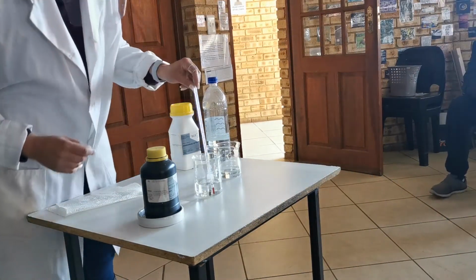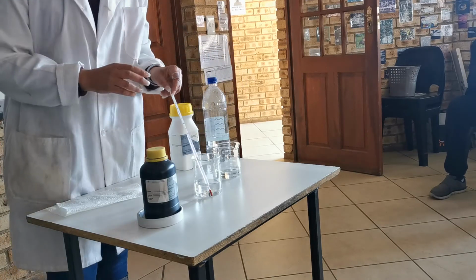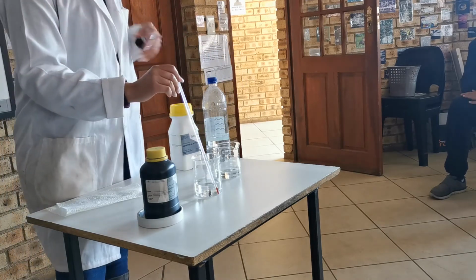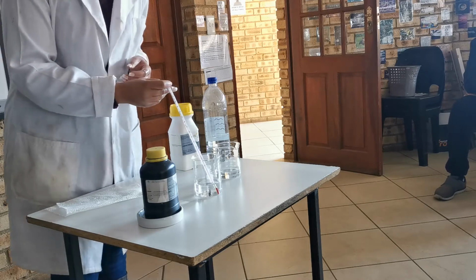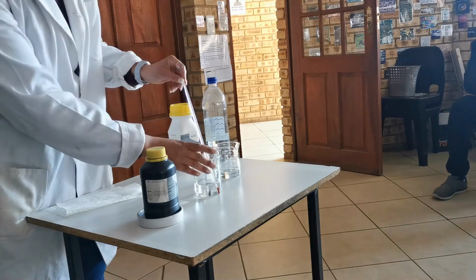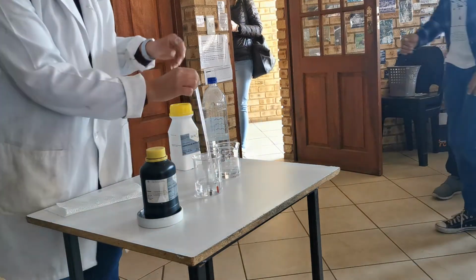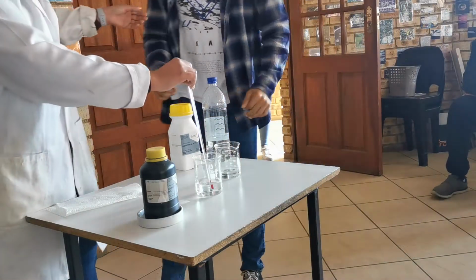Okay. So I have a temperature reading of around 10 degrees. That's how frosty it is inside of the classroom. For those of you at home, I hope you're warm. So we have our temperature of 10 degrees. Come on, Aaron, you're going to hold this for me.